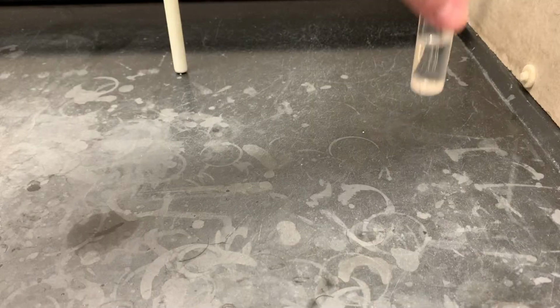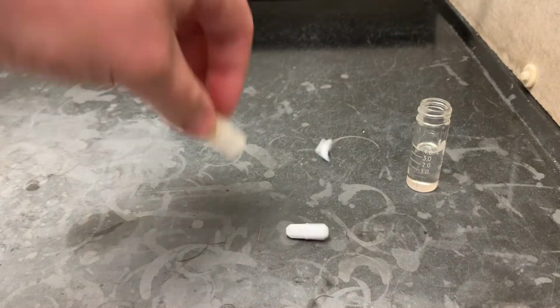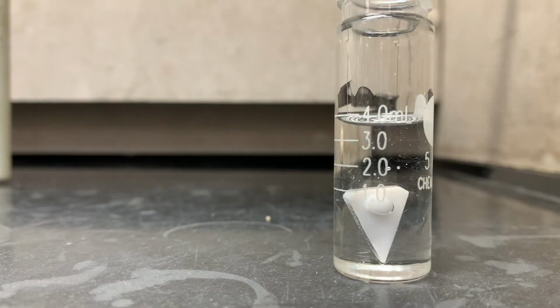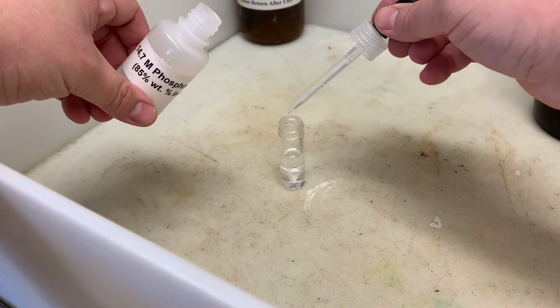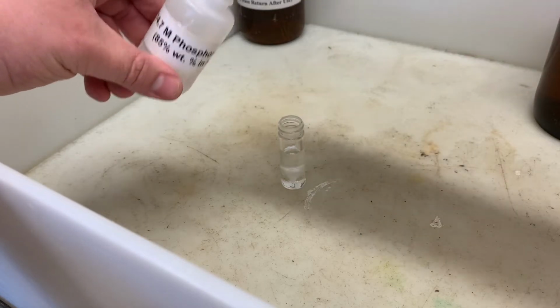So we're going to want to heat and stir it at the same time. We have 2 options for this, a stir bar and a spin vane. For this, the stir bar obviously is not going to work, so let's take the spin vane. To ensure that it's going to stir properly, make sure that it's facing point down. To measure out our acid, you can either use a graduated pipette, or far easier, you can just count out 14 drops. That will approximate the 0.7 mL, and remember, we don't need extra precision for this because catalysts get regenerated.